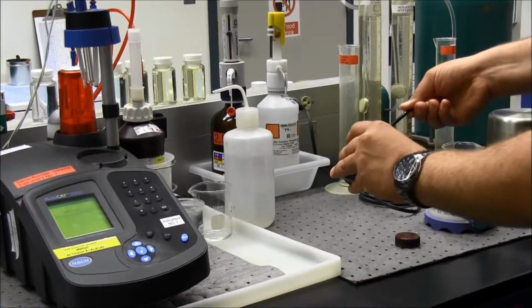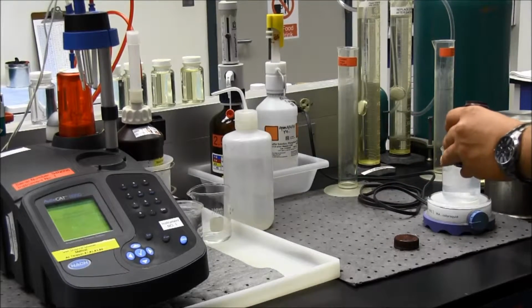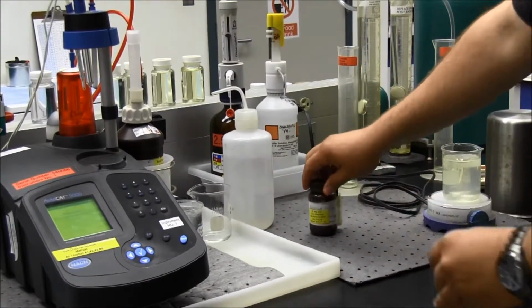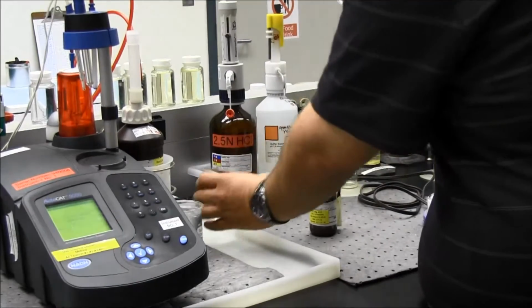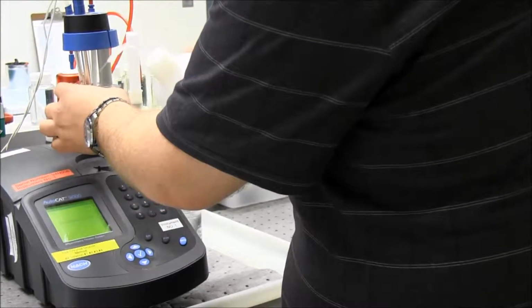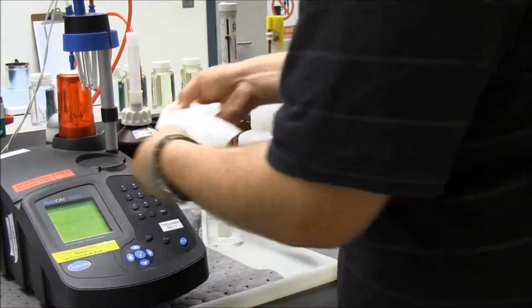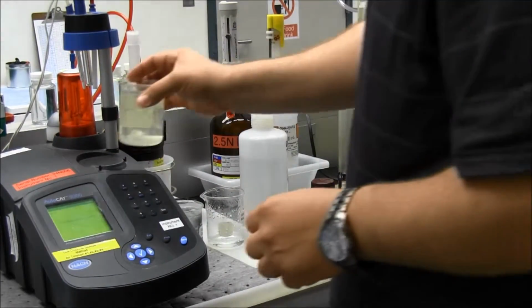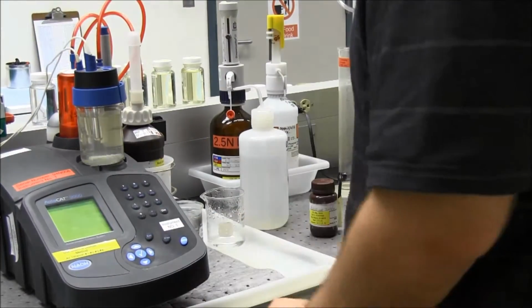What we're going to do is essentially the exact same 2 titrations, just on another sample. So I added that. I'll hit OK. Now it says reagents mixing. What I want to do on this one, though, is that this is a new sample, so I'm going to want to clean my probes in here so I don't get any water from the previous test on it. So I'm going to take my sample back up, dip it in, hit OK.